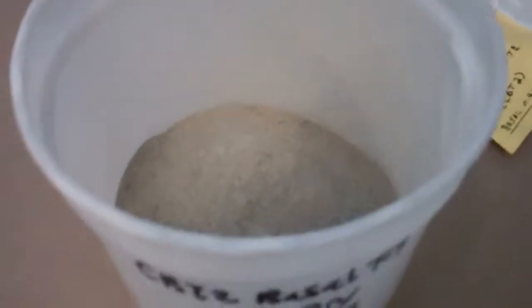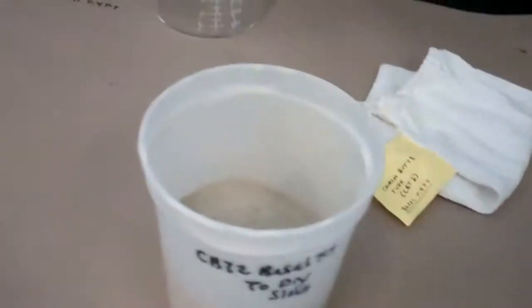Okay, so now I'm done crushing all of those rocks. And if you look over here, you can see they're all in here — they're very fine. It's like a fine sort of powder of rock. That's what we're looking at right now, in a very small form.